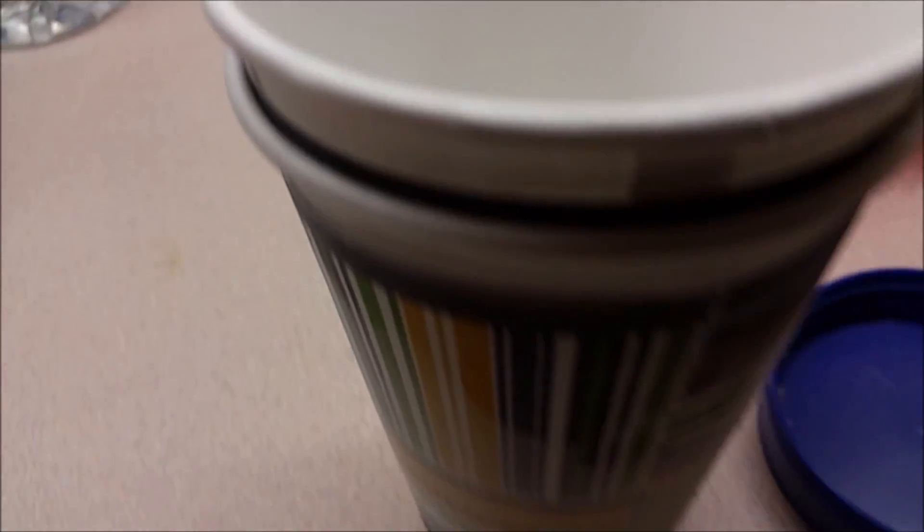There we go. You can hear it reaching the point where the nitrogen is actually sticking to the glass. That's making some funny noises, but I think the mercury is quite solid.